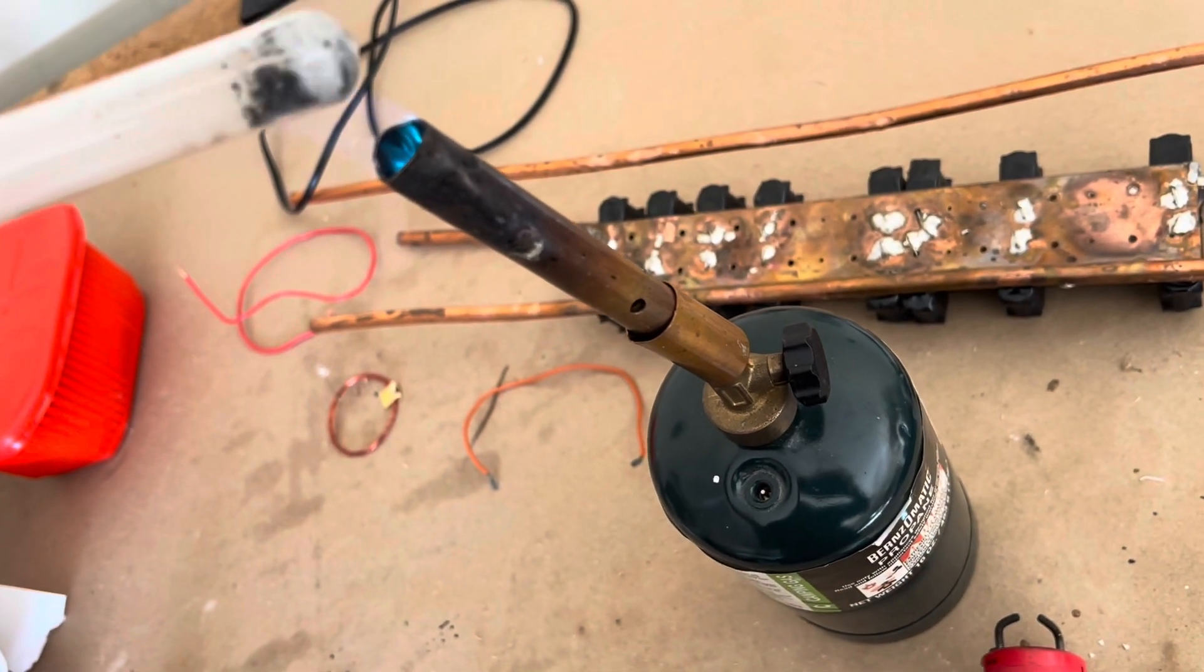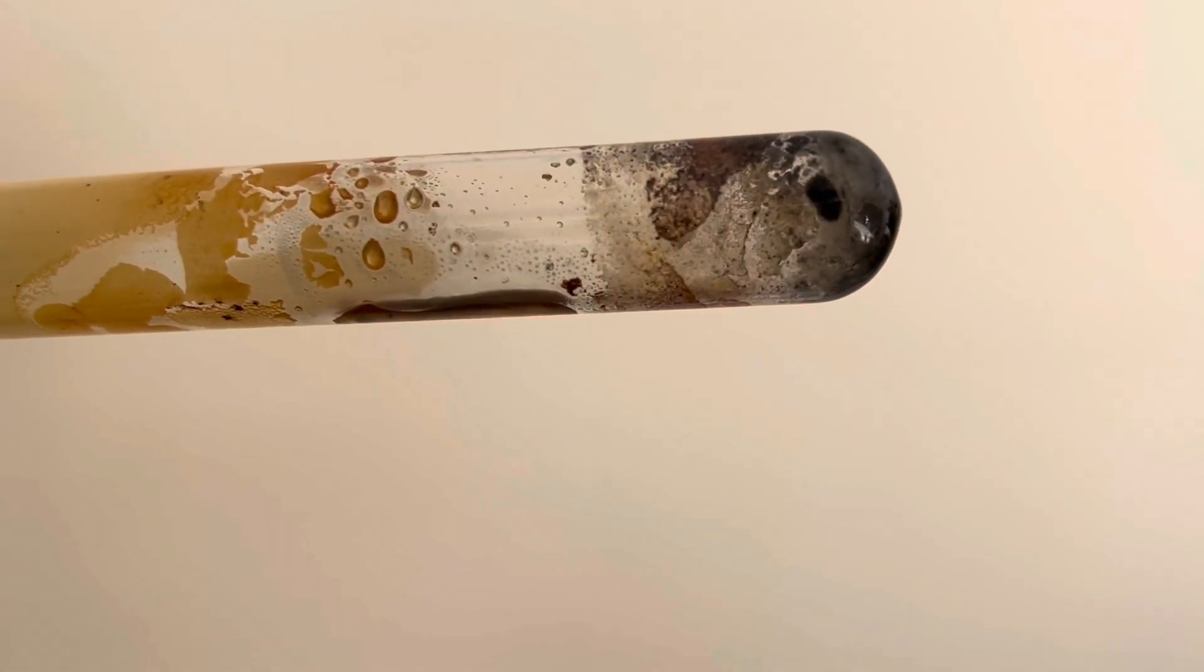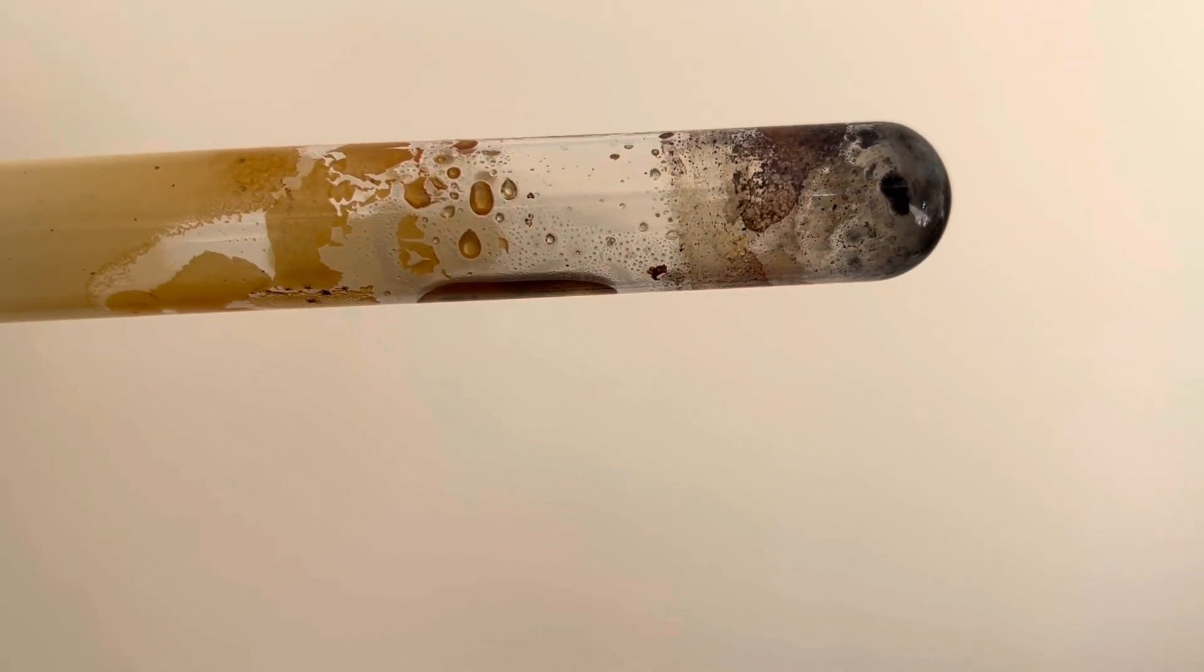And when that process is done, all the red form will be gone. And then you're ending up pretty much with a liquid form, as you can see here, which is basically liquid white allotrope.